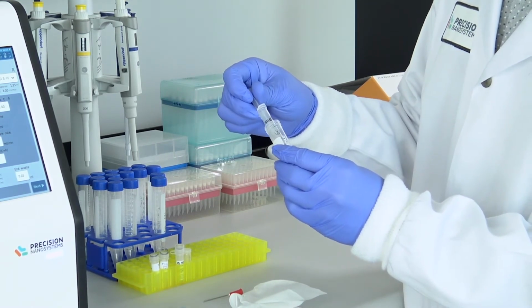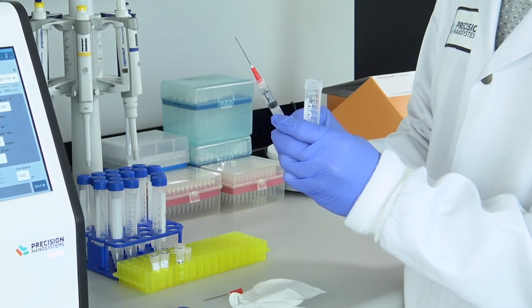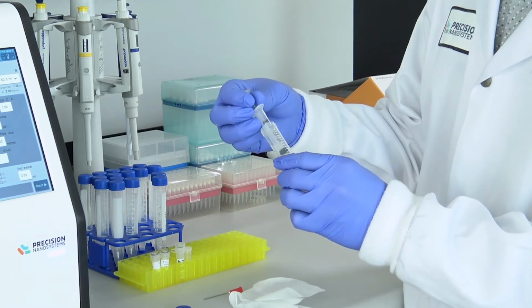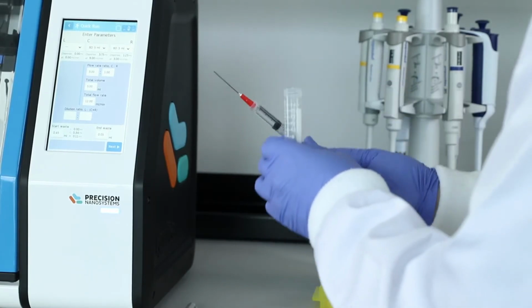Instead, new users can get up to speed very quickly, parameters can be transferred between users or to other departments or between collaborators, so researchers can concentrate their efforts on the multitude of other activities that are crucial to developing a vaccine or other nanomedicine.